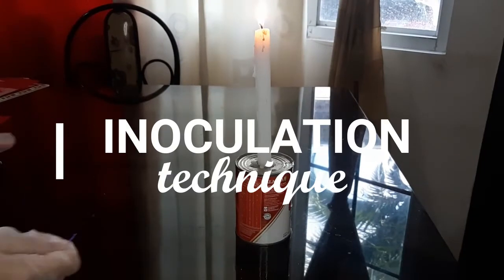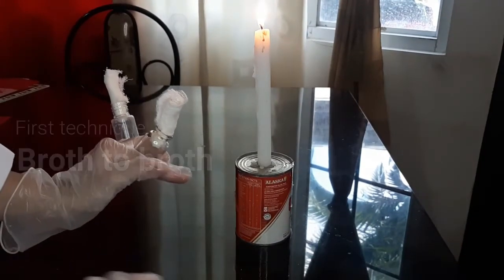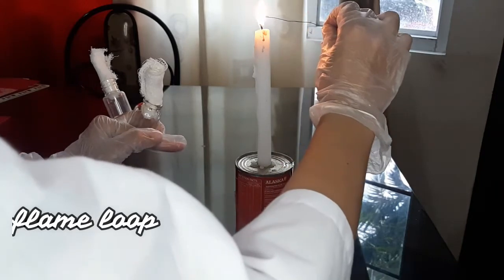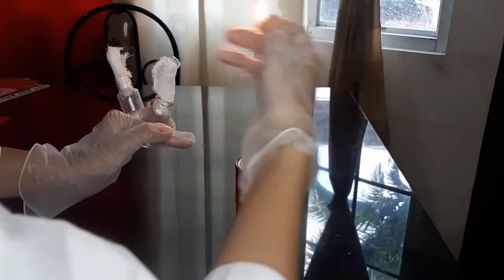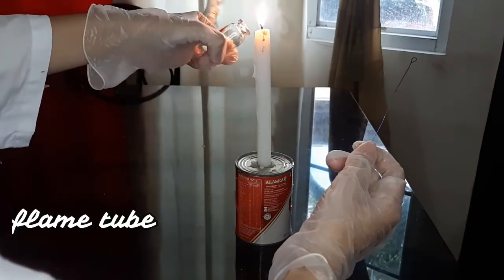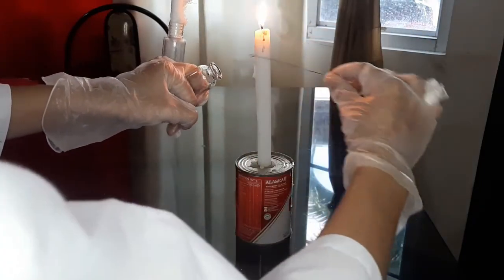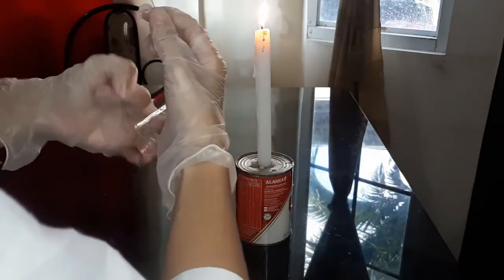The next technique is the inoculation technique. Inoculation is the transferring of an inoculum into a medium where they can grow and multiply. For broth to broth, flame the loop. Next is to remove the cotton plug and flame the tube. Dip the loop, flame the tube, and cover.